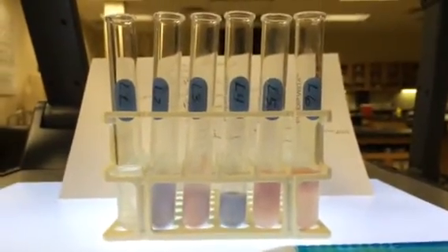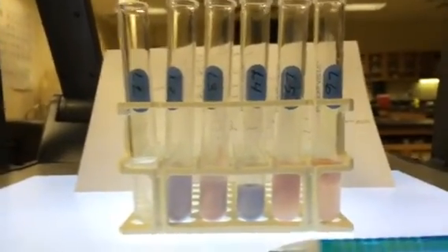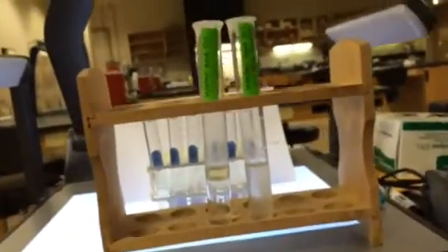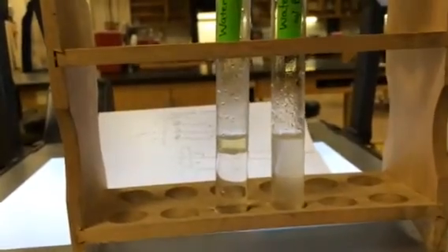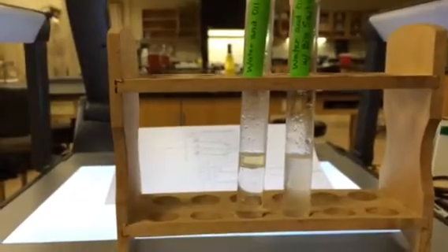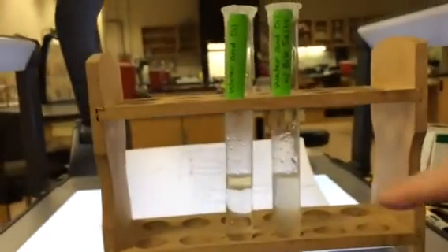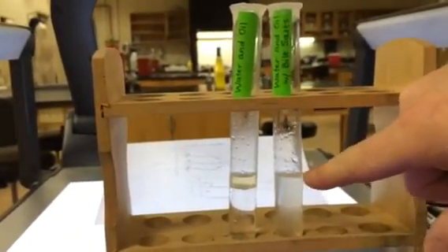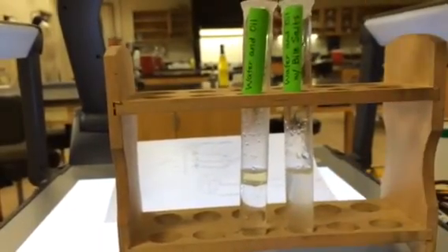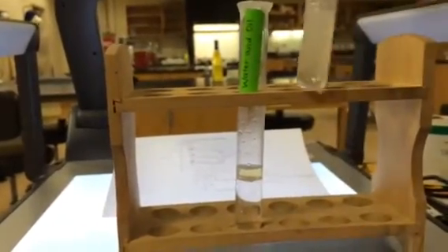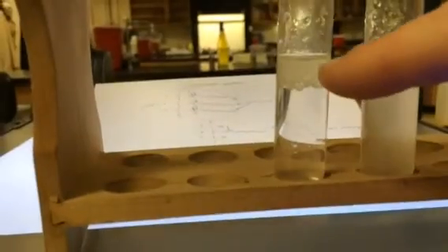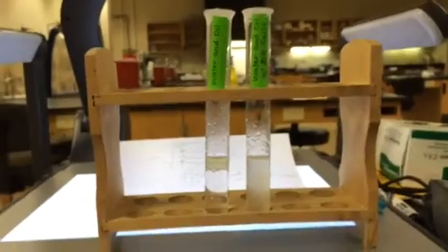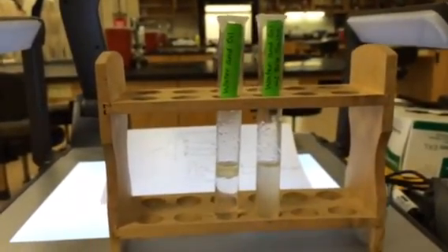Actually, let's do one more thing. So here we have water mixed with oil. And you can see that water and oil do not mix. Here we have water and oil with bile salts. And these are actually emulsified. Did you add the same amount of water and oil to each of these tubes? All right. So you don't see this thick film of oil on top of this one. You do see a little bit of oil there. But for the most part, the oils have become emulsified with the water. They've completely mixed with the water. If you shake it up, that result might actually be intensified a little bit. You don't see a lot of oily film up here. If you shake this one up, I'm shaking it just as vigorously, if not more. You can see that the oil quickly separates. So that's the action of bile, emulsifying fats in a watery solution that really helps lipases to do their job in the small intestine. Thank you very much.